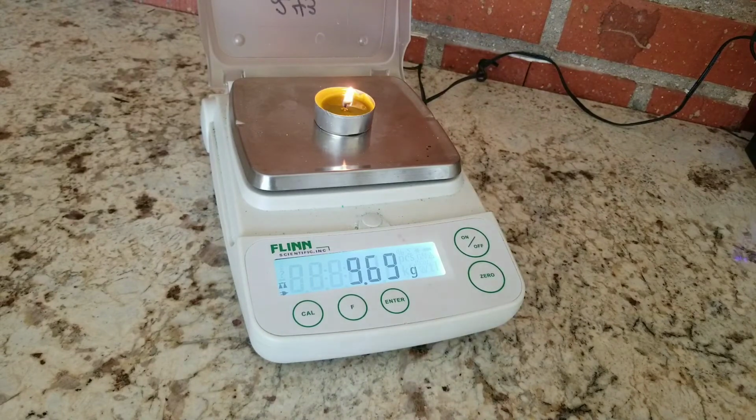That's our 240 seconds. 9.68. That's our 270 seconds. And we're going to do one more.